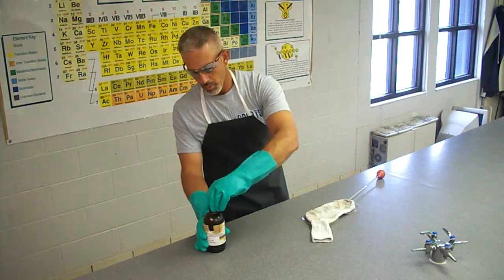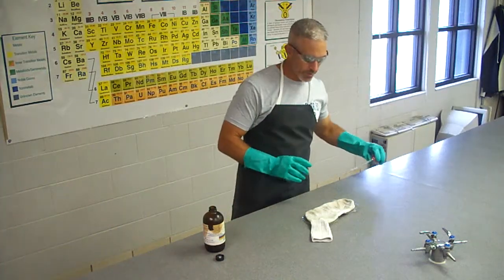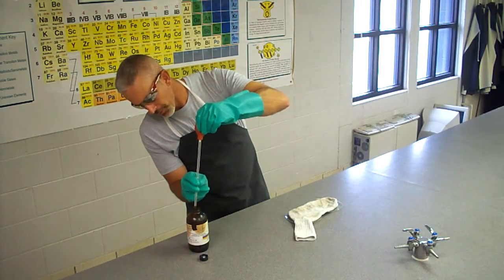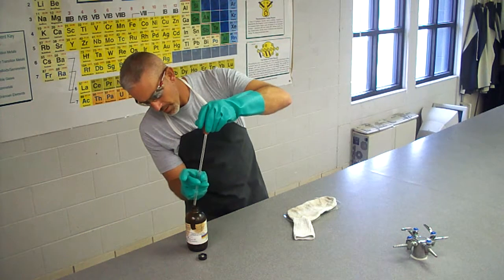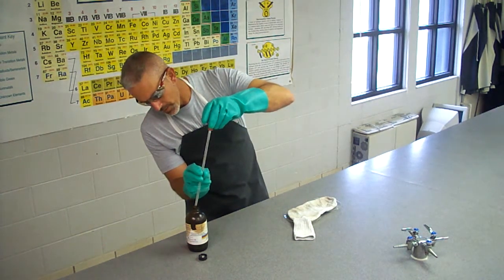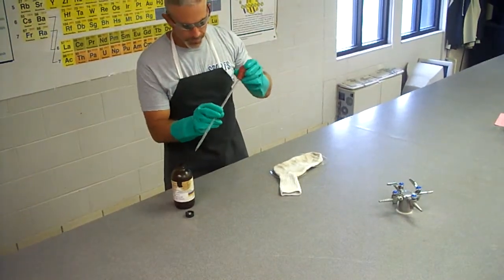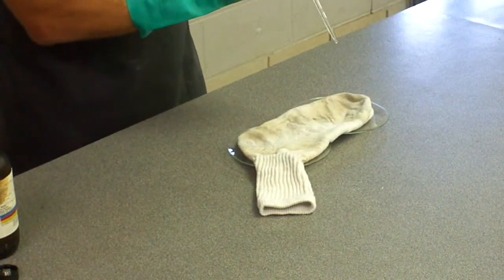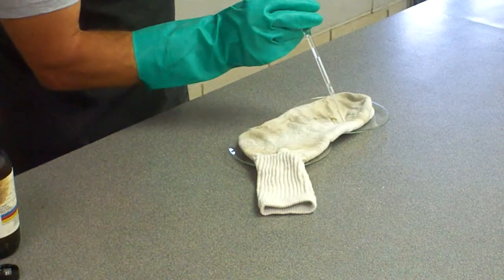So we'll go ahead and take this cap off here, and we'll use our pipette to extract about 5 milliliters of sulfuric acid. And as we put it on this sock, I want you to notice how it affects the cotton of the sock. I'm going to go ahead and write the chemical formula for sulfuric acid.